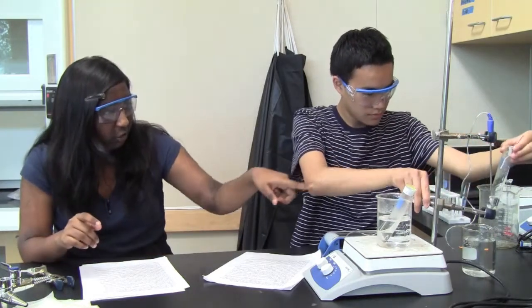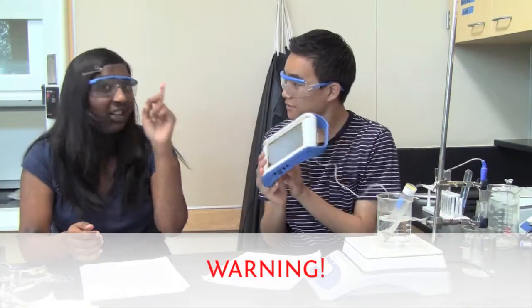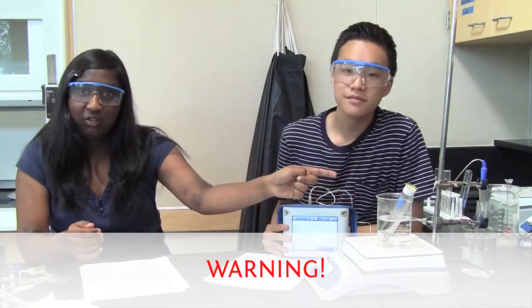So, using the clamp, you want to clamp that test tube so that it's kind of floating in that beaker. Warning. Don't let that stuff spill on you. Seriously. You don't want to be seriously injured. And don't touch the bottom of that test tube.